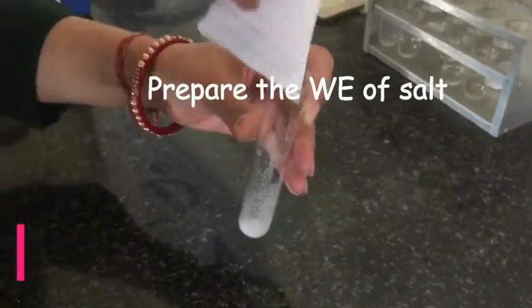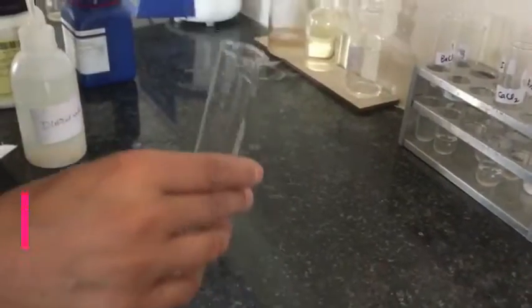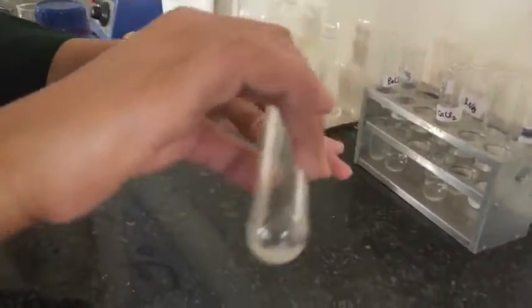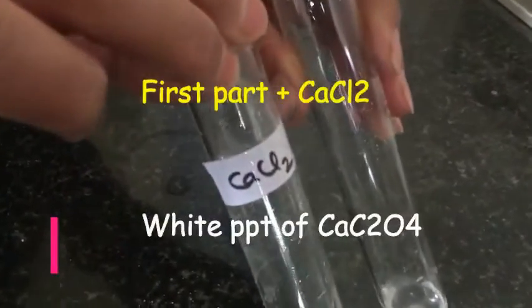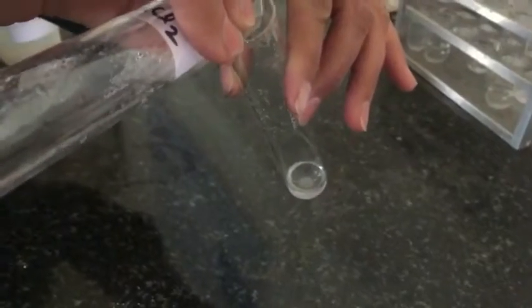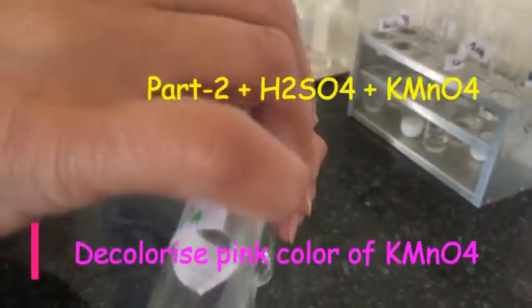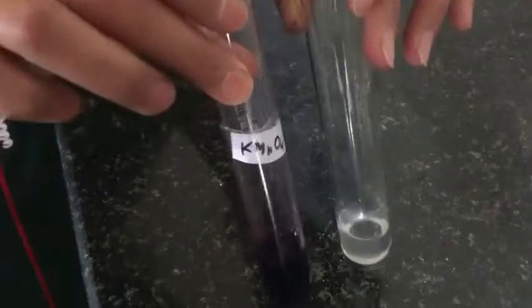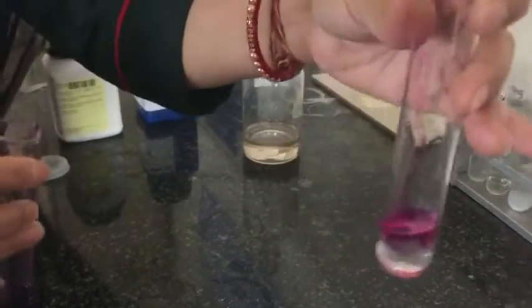Now test for oxalate ions. I have taken the salt and prepared the water extract — not the carbonate extract, because in this case carbon dioxide is also evolved and would interfere. I have divided this water extract into two parts. To the first part I have added calcium chloride, which forms a white precipitate of calcium oxalate — here you can see it. To the second part I have added concentrated H₂SO₄, and then freshly prepared KMnO₄ solution. The oxalate ions decolorize the purple color of KMnO₄.